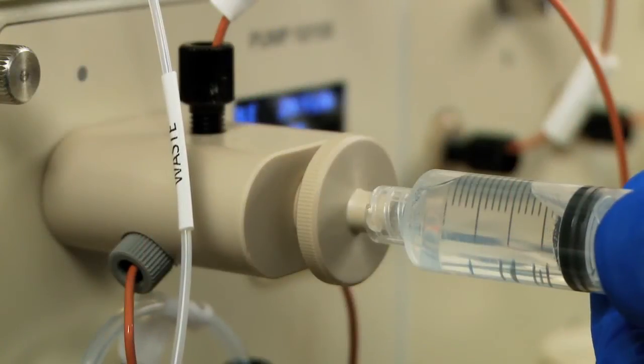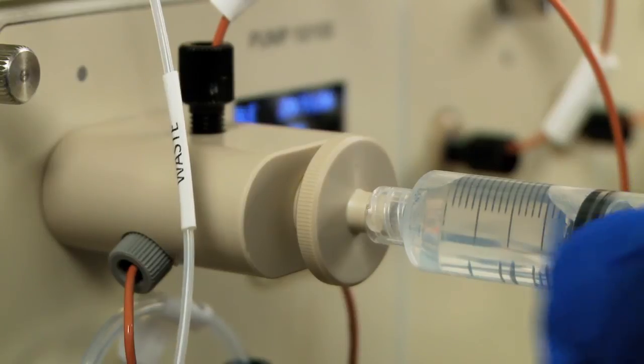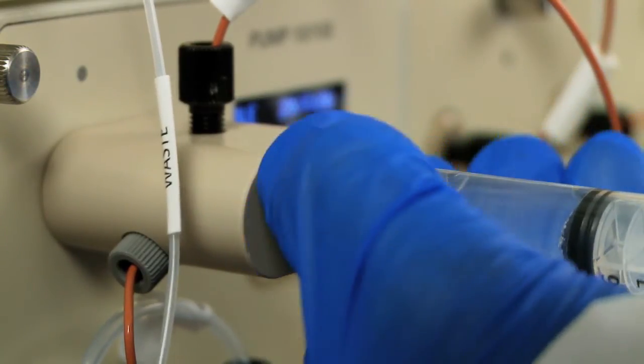Be careful not to push air back into the pump while closing it. Now, detach the syringe.